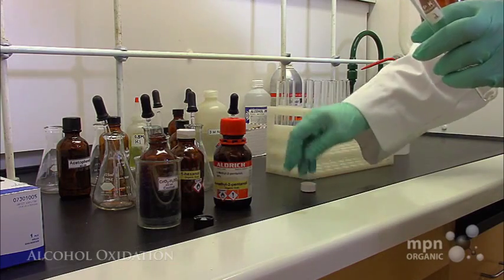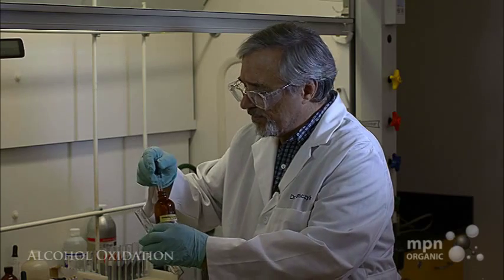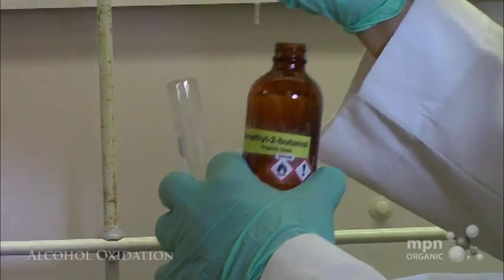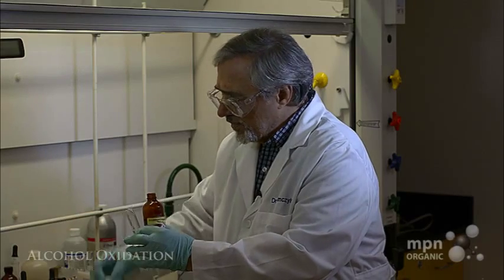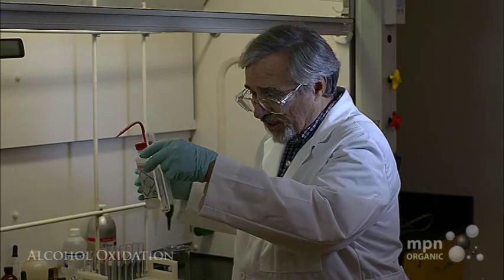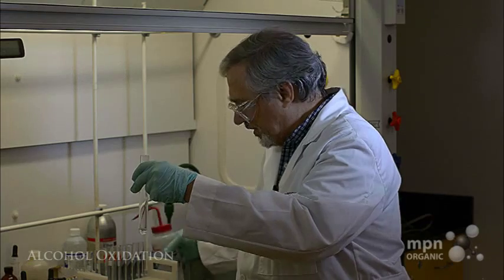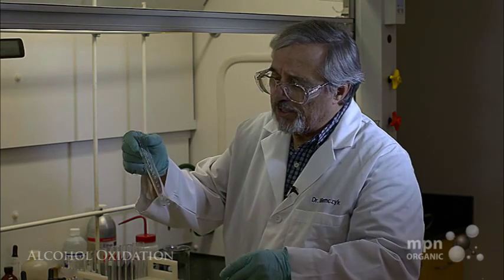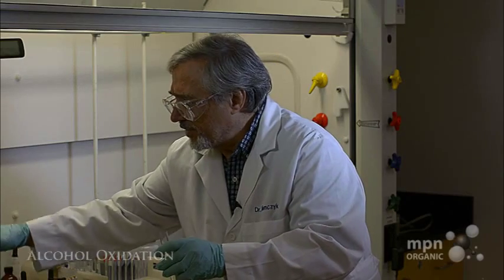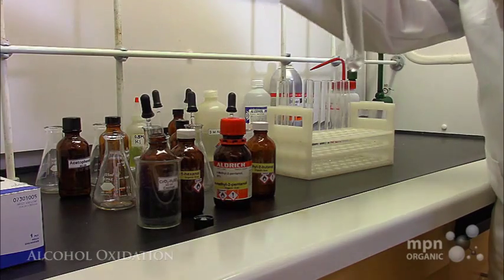Now, the tertiary alcohol, let's put a little bit here in our test tube. Okay. A few drops, 1, 2, 3, 4, yeah, that's about it. Acetone as a solvent, so let's put that in there too. Okay. So we've got our tertiary alcohol in here, and acetone as a solvent. And now we're going to put a little bit of the oxidizing agent in there.